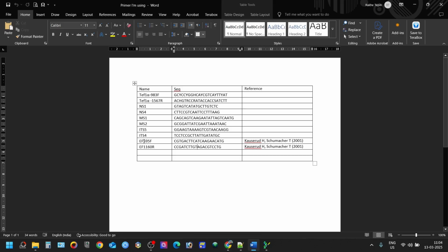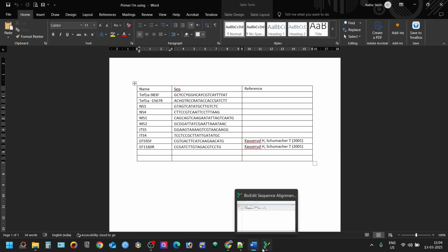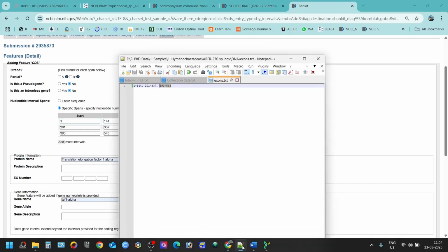The complete sequence would have been from 1 to the end of the gene, because there are other primers that I've also been using. For example, this one amplifies the same gene, elongation factor 1 alpha. This is also elongation factor 1 alpha, but this amplifies from 983 to 1567, and this amplifies 595 to 1160. So now we're done with that. We know our sequence is partial because it is incomplete.